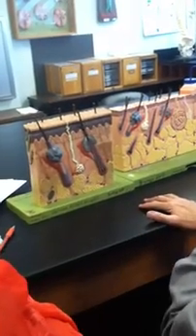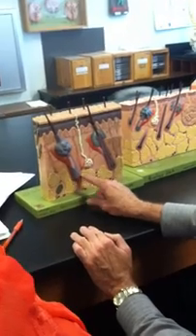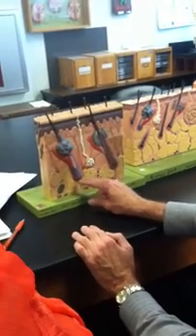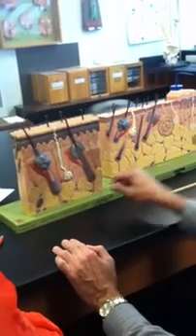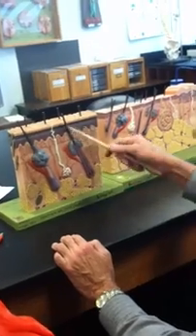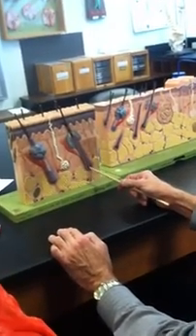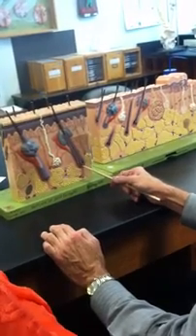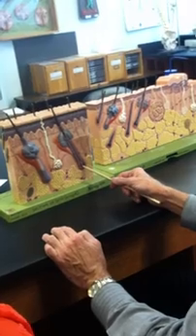Now, the hair follicle has a rounded bottom called a hair bulb. This is the hair bulb. Okay, I can take a hint. And this sectioned follicle shows the hair bulb has an indentation within it. That's the hair papilla. So you can see capillaries going into the hair papilla.